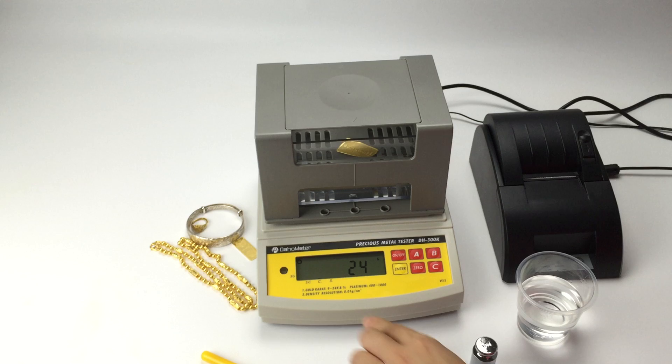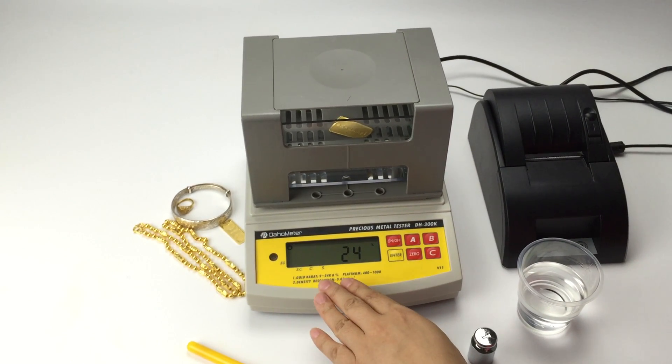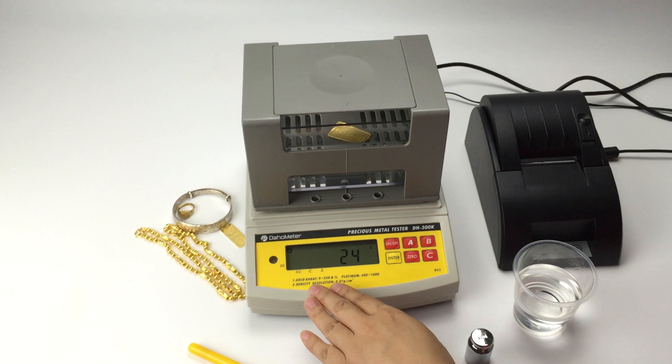Press A. The arrow is shifted to C, which means this is the K value for gold, copper.